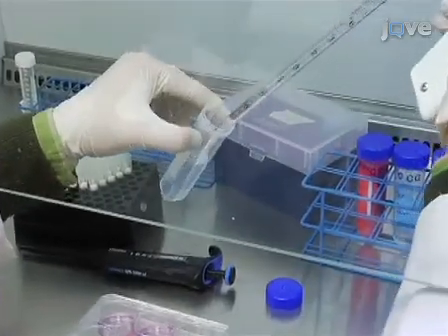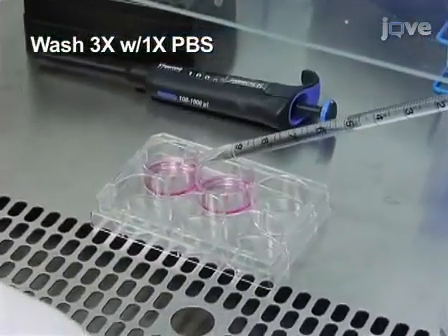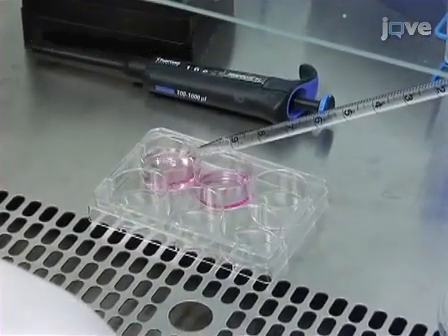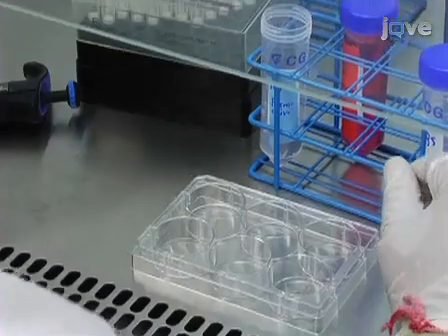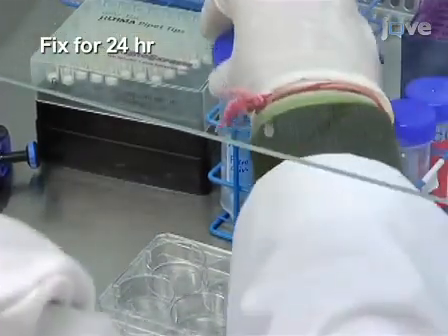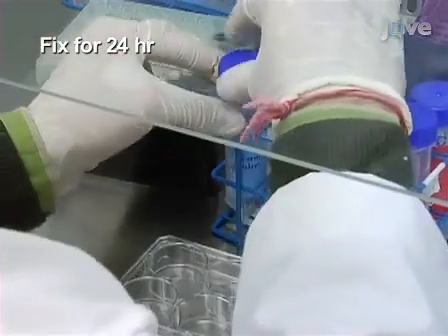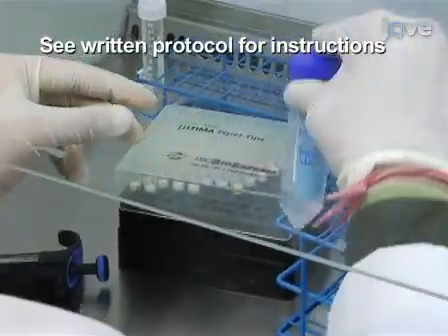After the incubation, wash the blocks 3 times with 5 milliliters of 1x PBS. Then, in 50 milliliter tubes, fix the blocks with 10 milliliters of 10% volume per volume formalin for 24 hours. Paraffin embed the tissue and cut 4 micron sections.